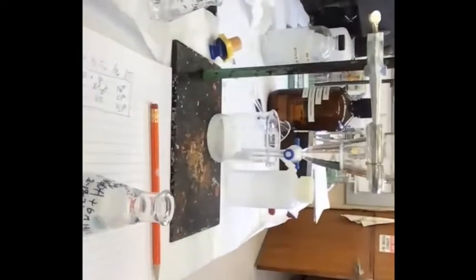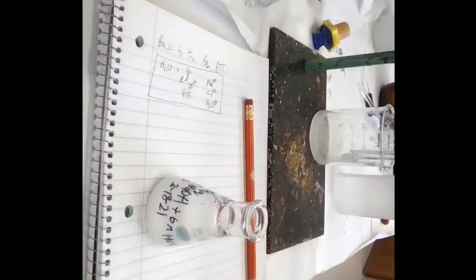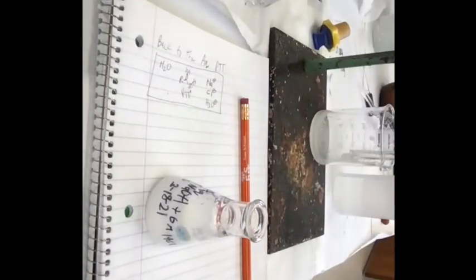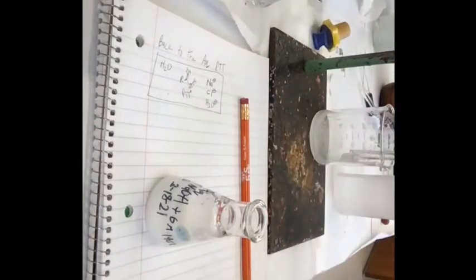I can do 2 things, actually. Could you add the sodium sulfate? No, sodium sulfate's for very trace amounts of water in an organic. This here is like 55 molar water. So sodium sulfate, it'll just dissolve until it's saturated. Could you filter it? Yeah, we can do 2 things.